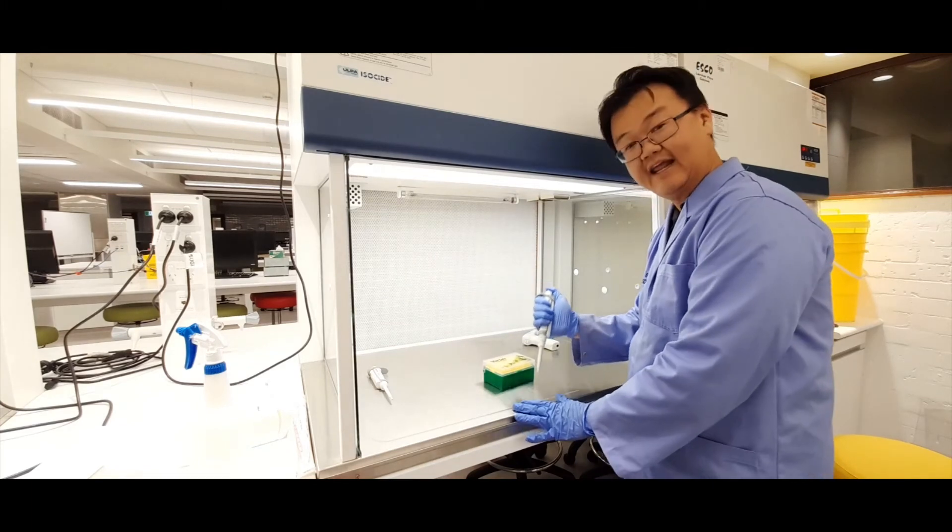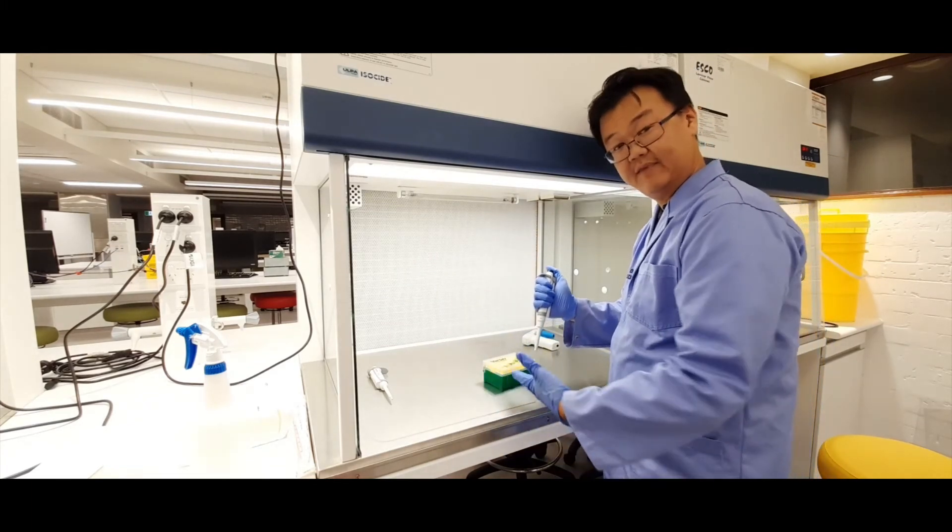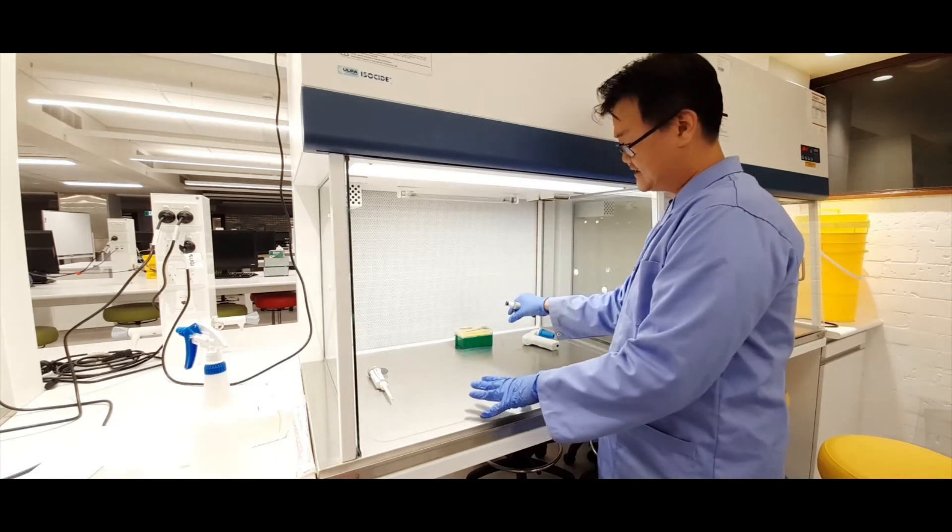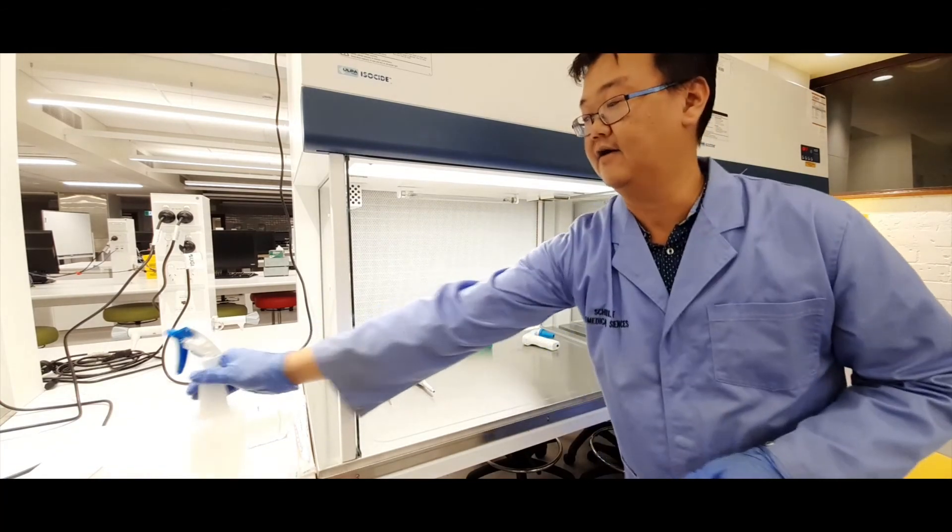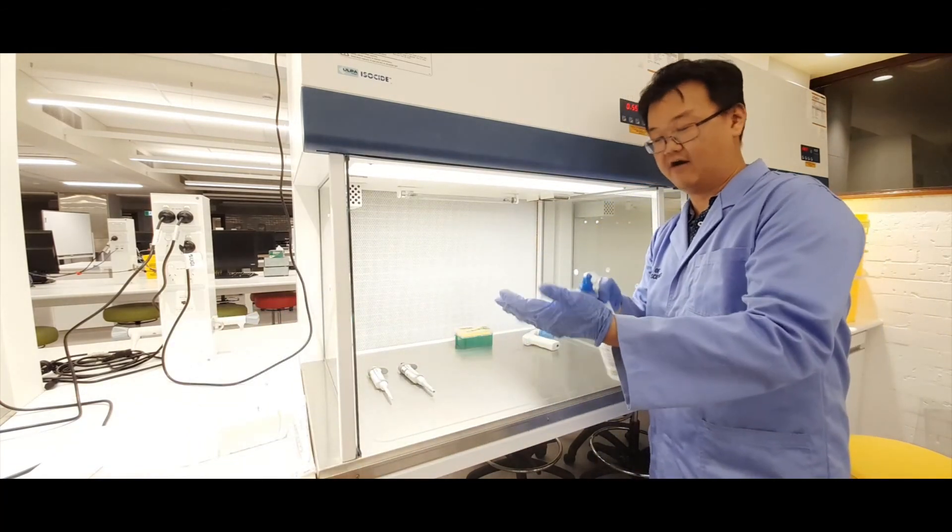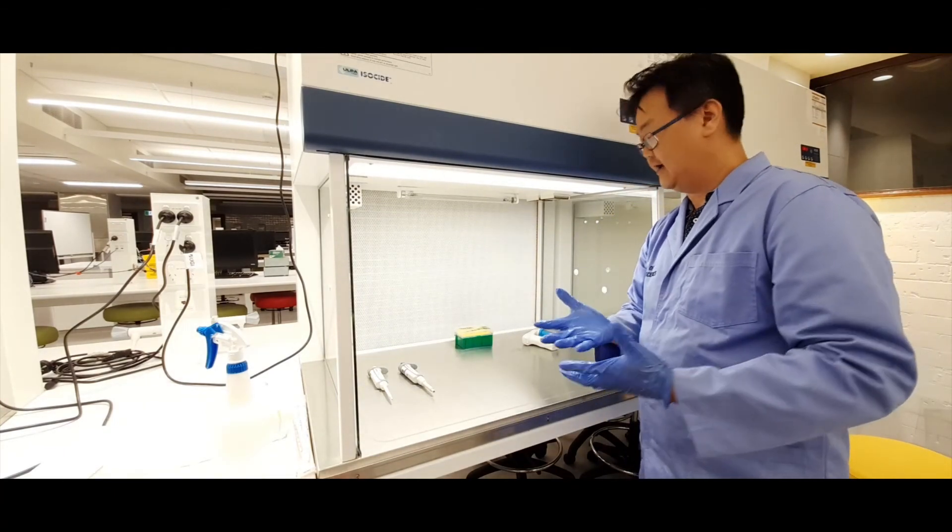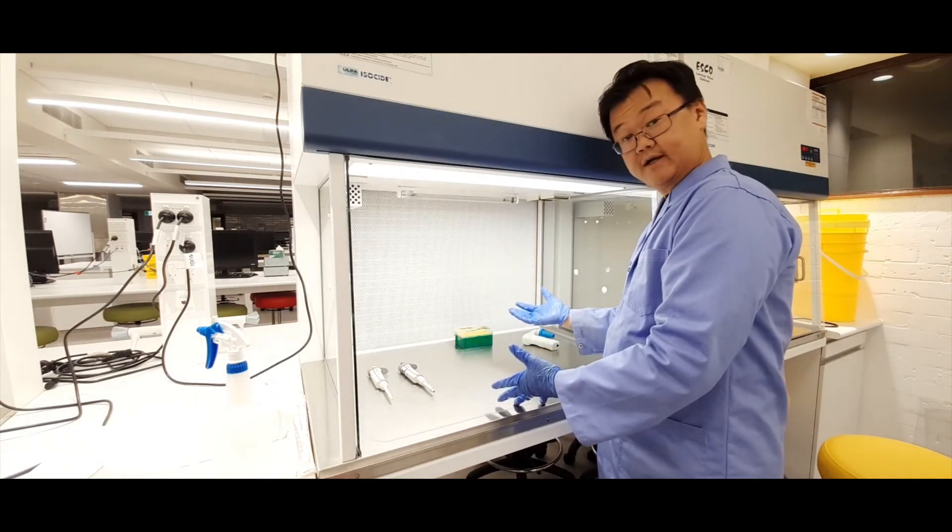Okay, so make sure you're working inside the hood. Wear gloves, and also it's a good practice to sterilize your hands with 70% ethanol periodically while you're working in this sterile environment to do your cell culture work.